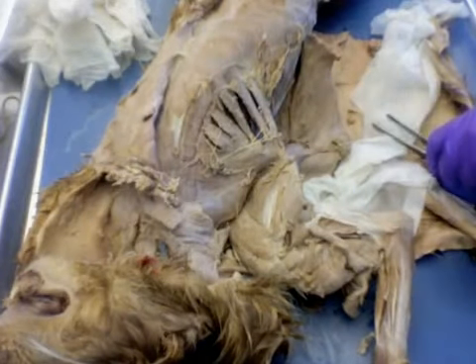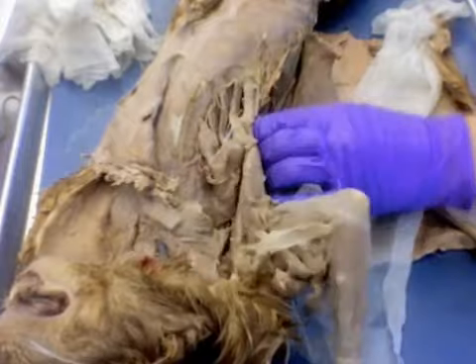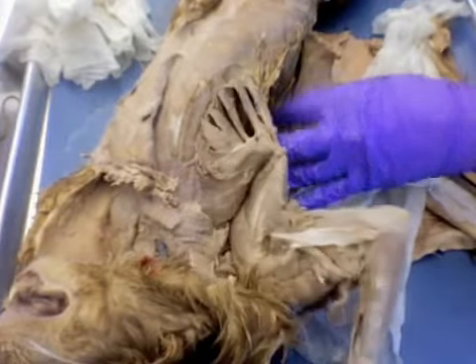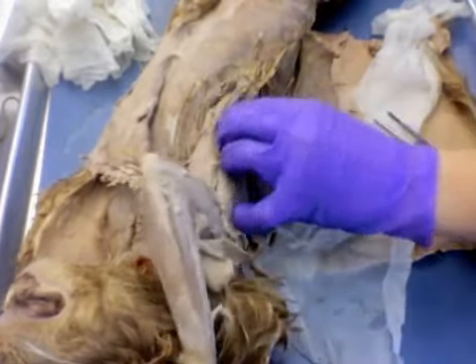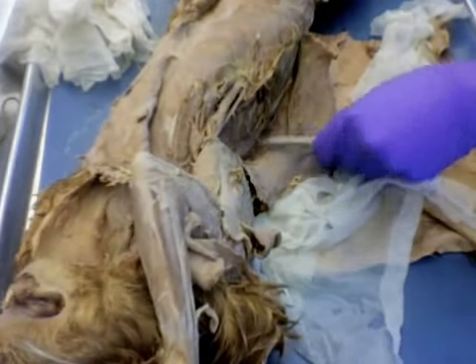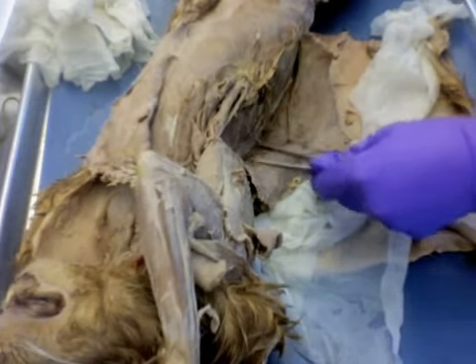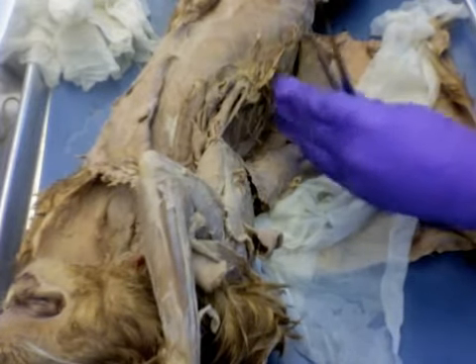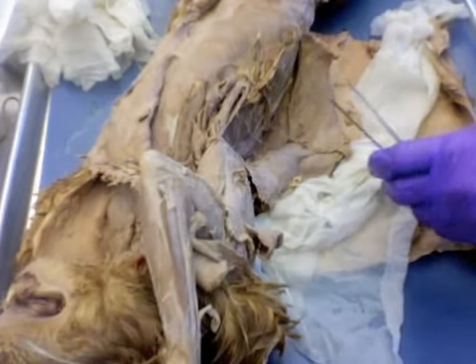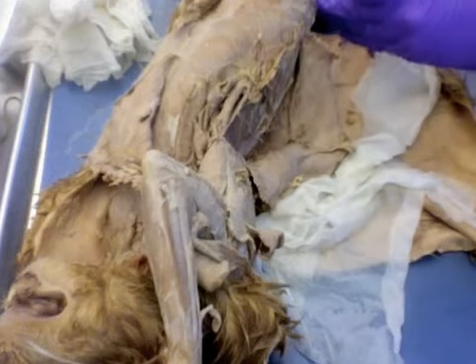And then finally, our serratus dorsalis, which is sort of above and a bit behind the serratus ventralis. So serratus dorsalis is right in here. Serratus dorsalis cranialis in there, so cranial towards the head, and then serratus dorsalis caudalis, caudal towards the back.